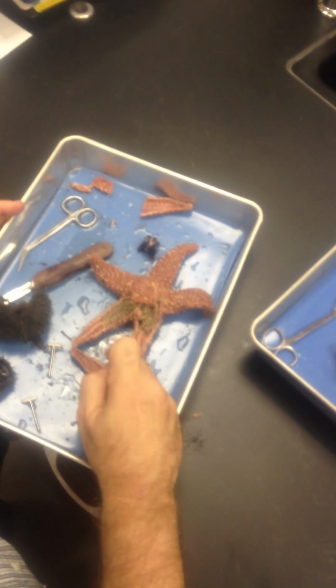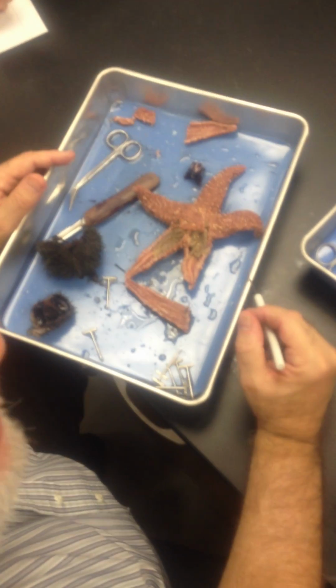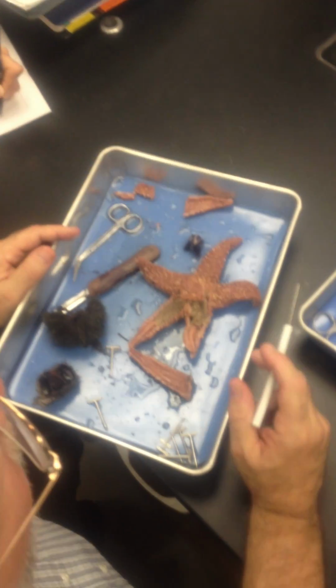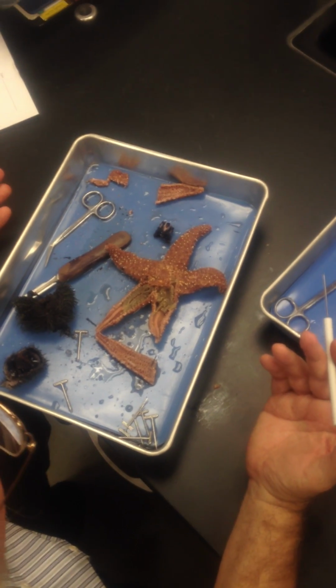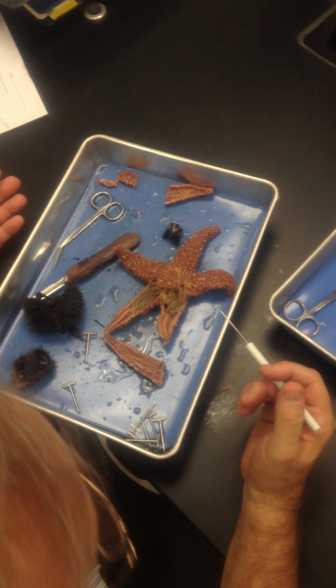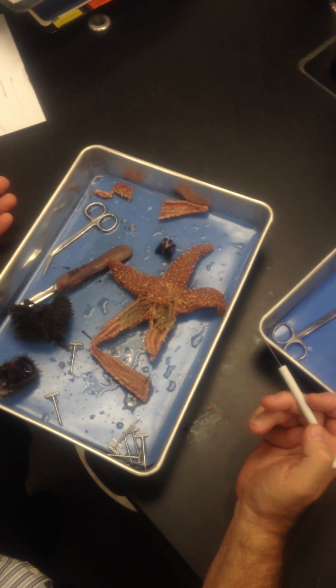Pyloric cecum, or digestive gland. You can't come up with your own anatomical parts. Well, I said part of it. I mean, there are names, and if you go to human anatomy, there are real names. I'm not saying there aren't other names for these things, but pyloric cecum or digestive gland. Are we all right with that?